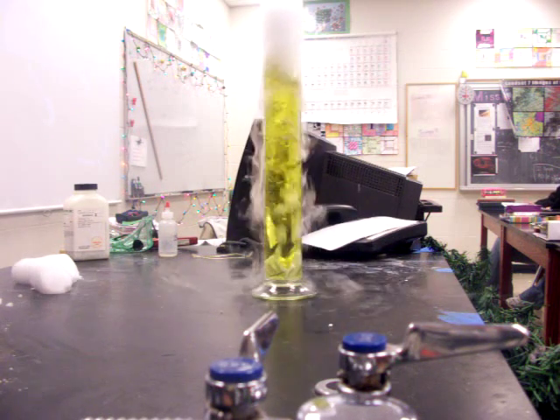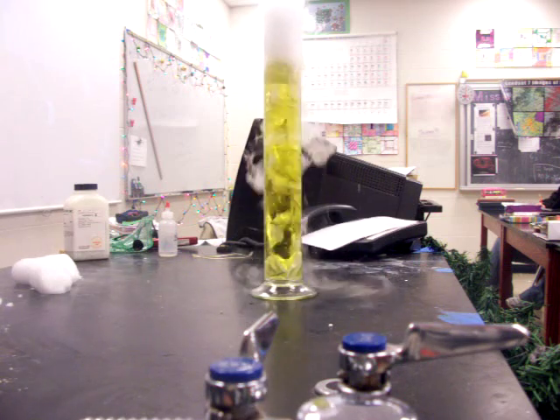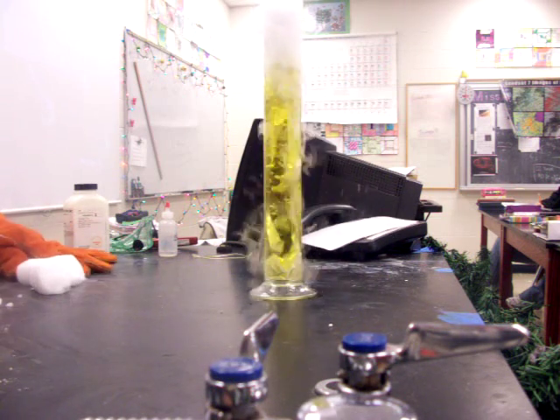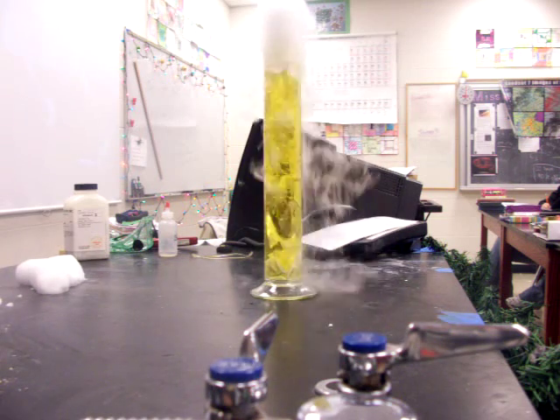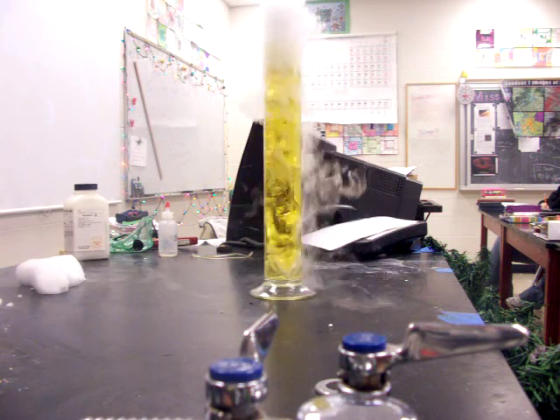which is what we have with an acid, and it should continue to bubble here, and we might be able to get it into a slightly orangish tone. There I can begin to see a darker yellow at least.